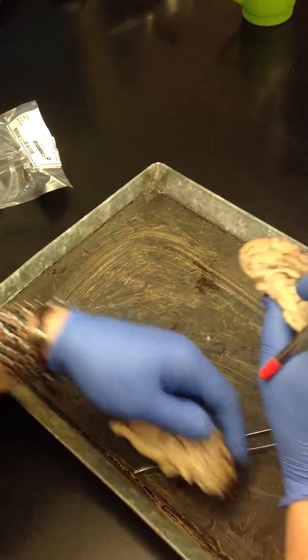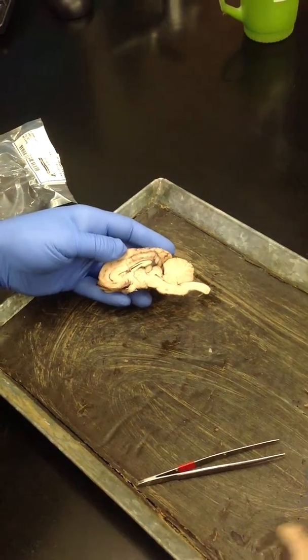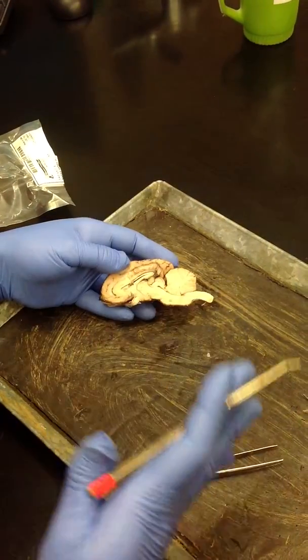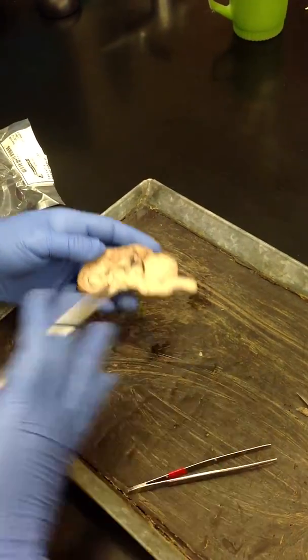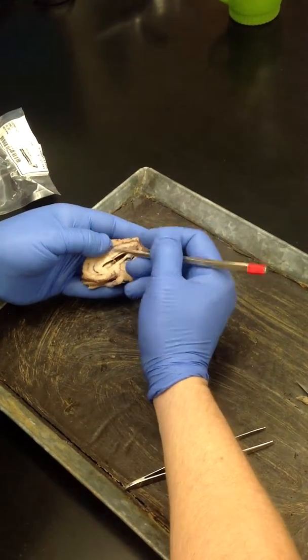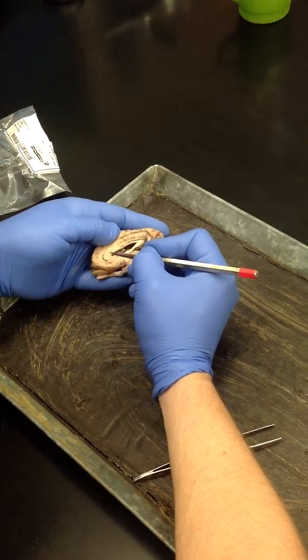This side is actually better for most of it, so I'll use this side. On that side you can see the pituitary gland. The reason you don't have things paired is because it wasn't a true mid-sagittal cut when they did this. They did it slightly off-center, and that's why you can't see everything completely paired. But if we come back here again, that thin white band right there is the corpus callosum.